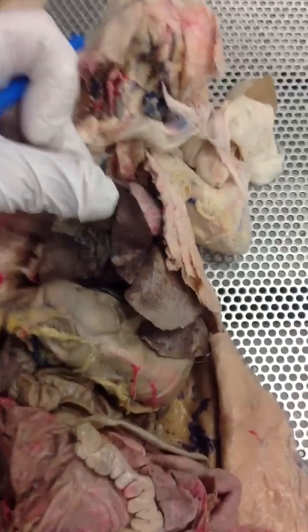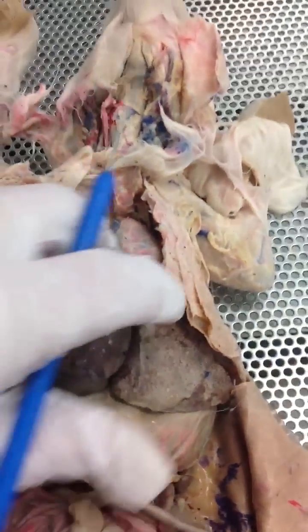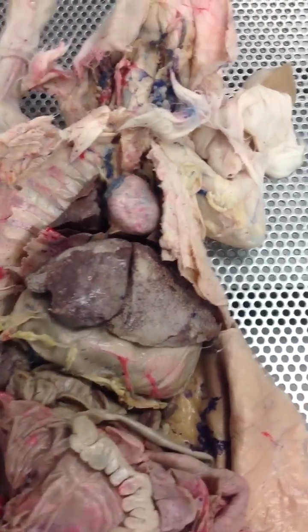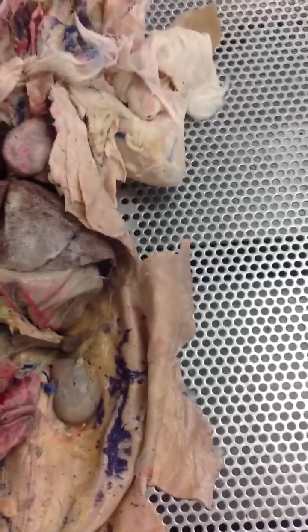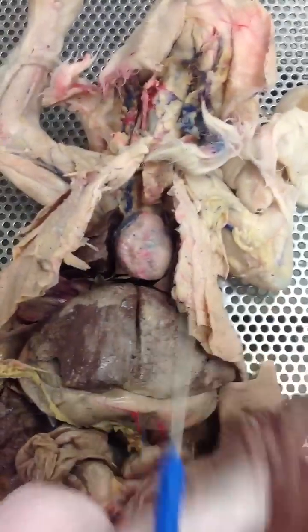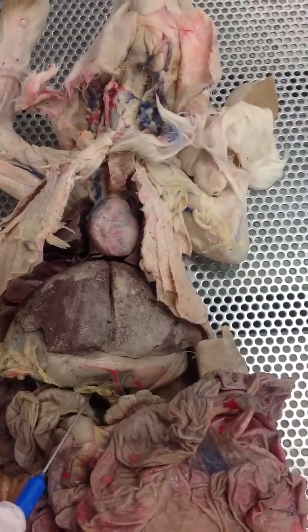Under the liver, if you lift it up, you're going to see that green portion right there by my finger — that's going to be your gallbladder. Underneath the liver, this is your stomach right there. Lifting up the stomach and moving out the intestines, you can see your kidney right there. And going into the intestines, this yellow portion right here is going to be your pancreas — the yellow part that connects to the stomach and the intestines.